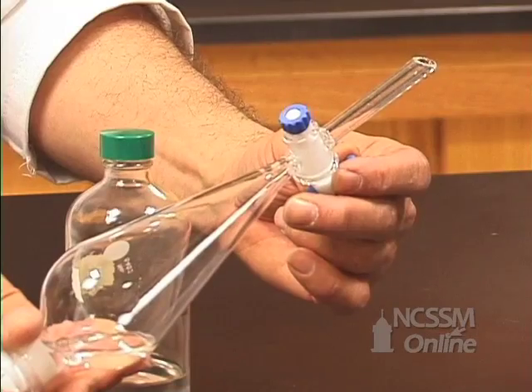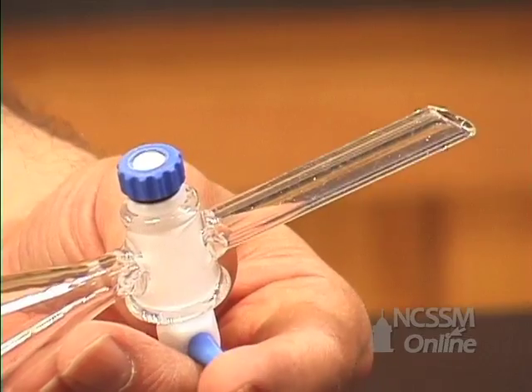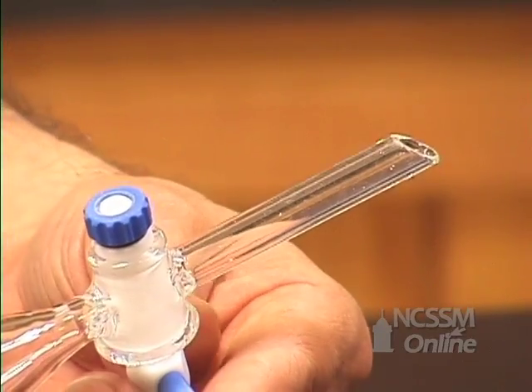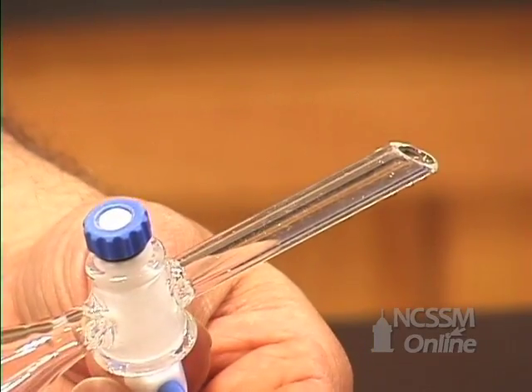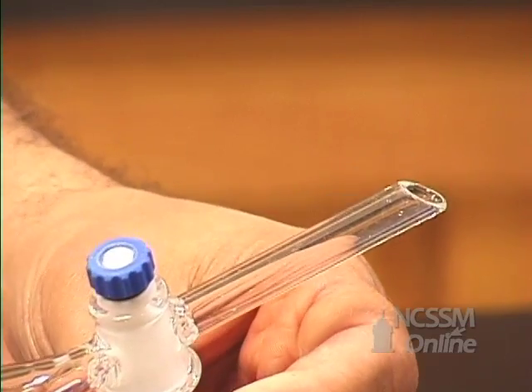We close the valve, shake the separatory funnel again, open the valve, and observe the results.